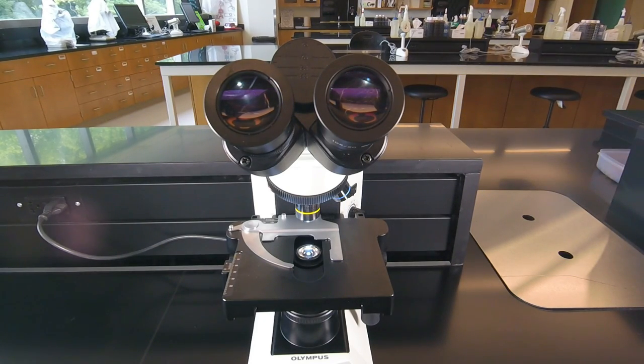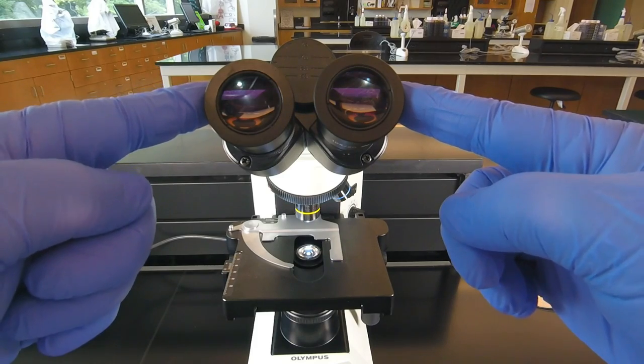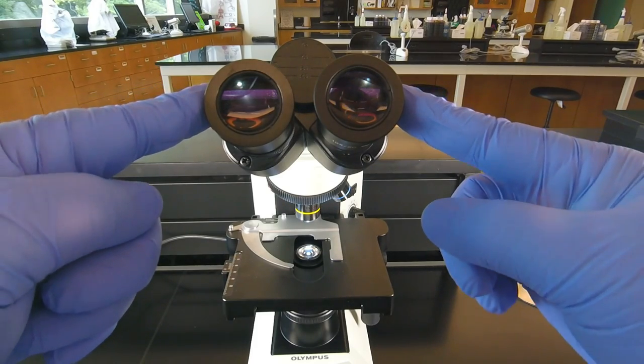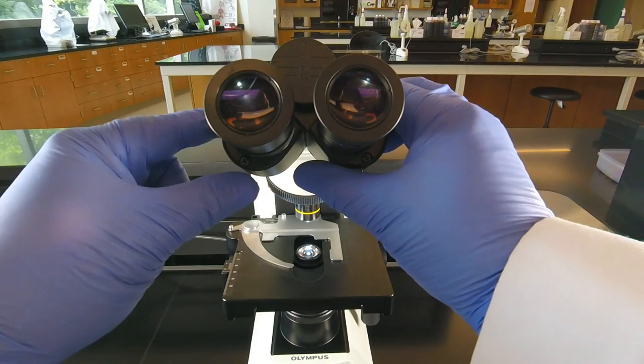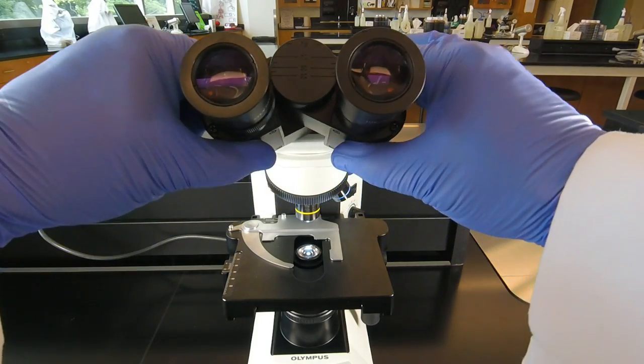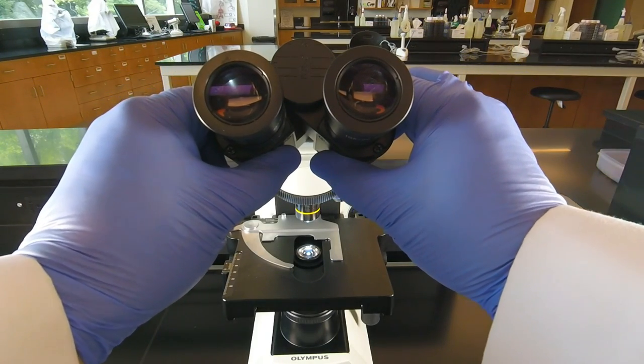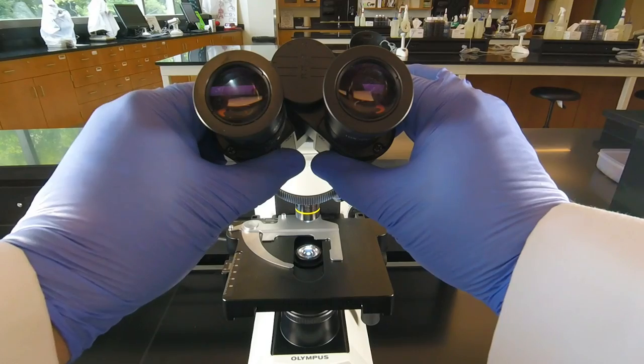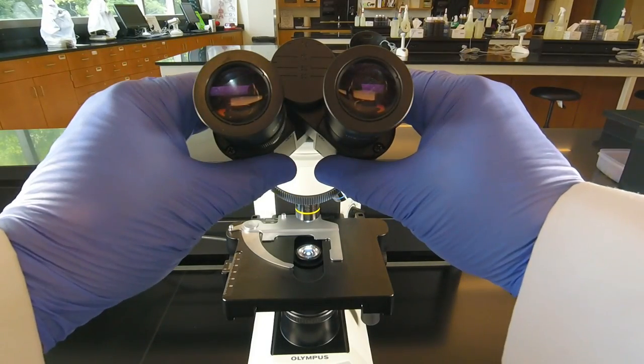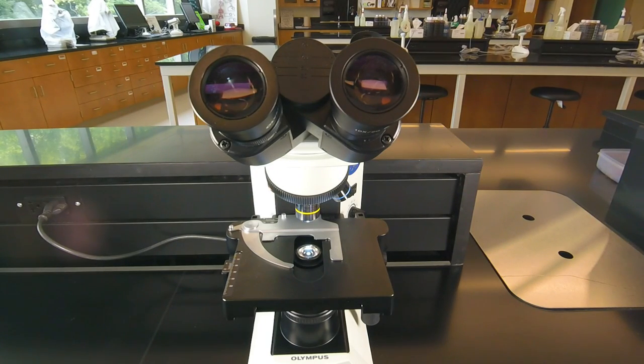And then it's just a matter of keeping your head steady and adjusting the eyepieces so the distance between the eyepieces matches the distance between your eyes. So these particular microscopes, both sides or both eyepieces turn, so we can spread them apart by lifting them up, put them closer together by lowering them. And we want to basically put our eyes up where they need to be and start adjusting the pieces till we're seeing one circle of light with two eyes.